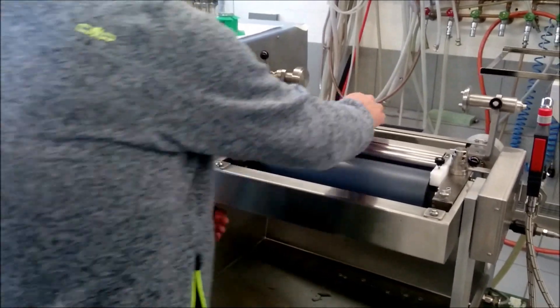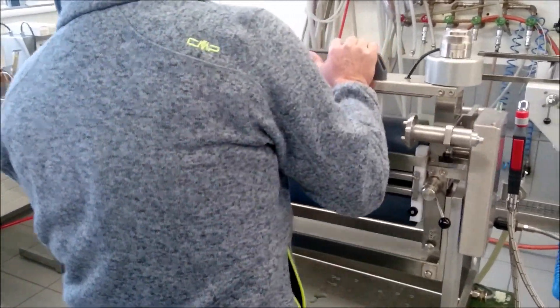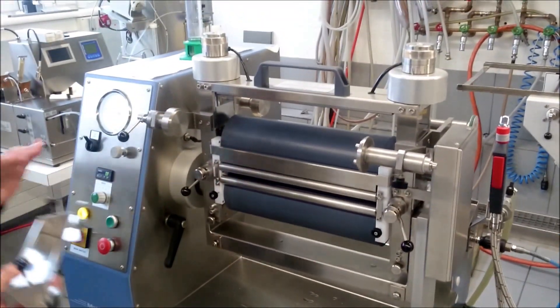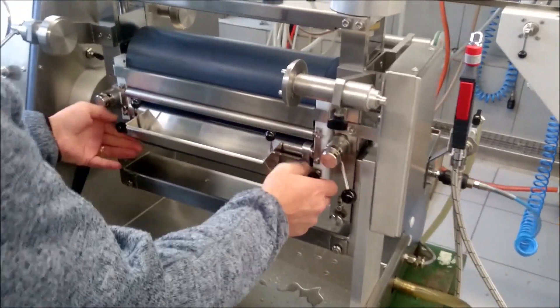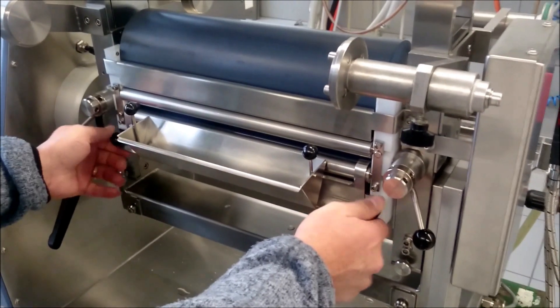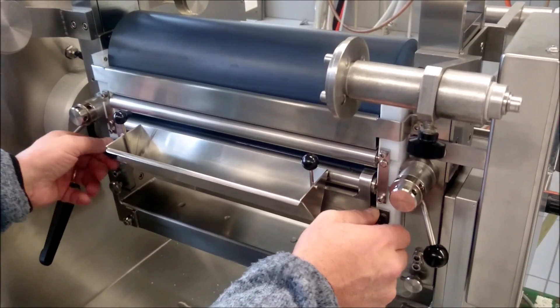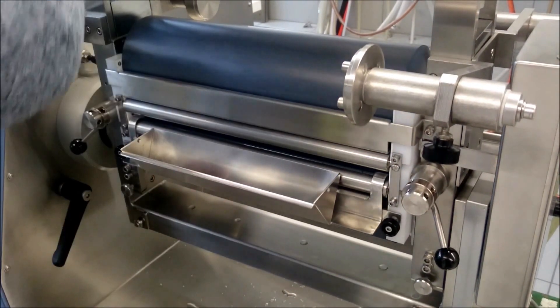We go to vertical position to use small 200ml troughs. We put it in front of the rollers. Take out.